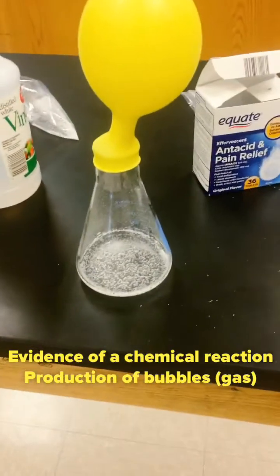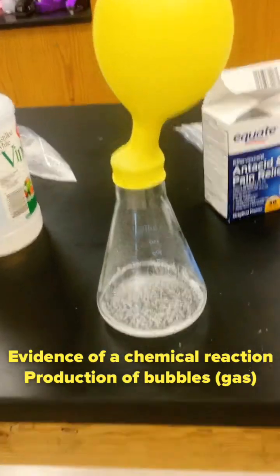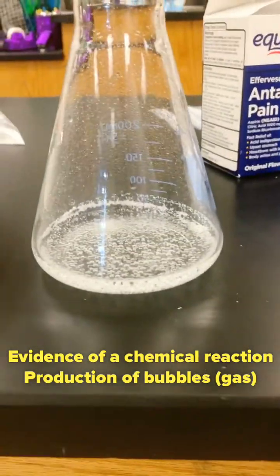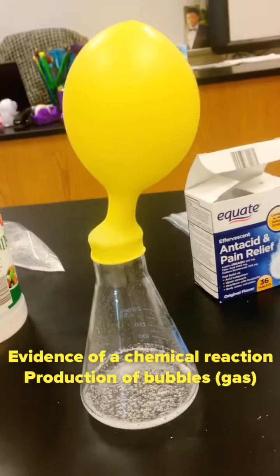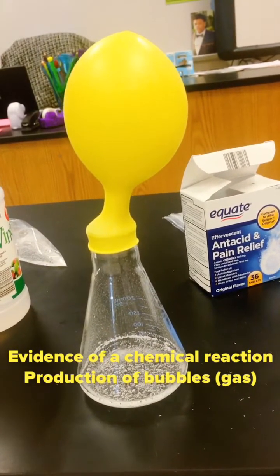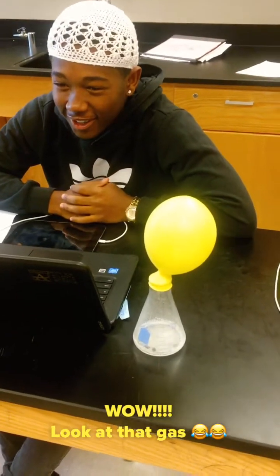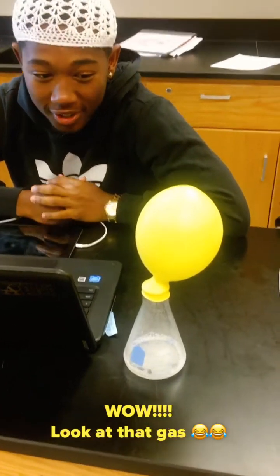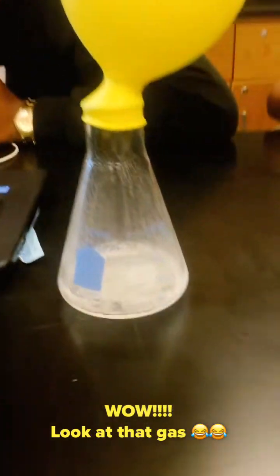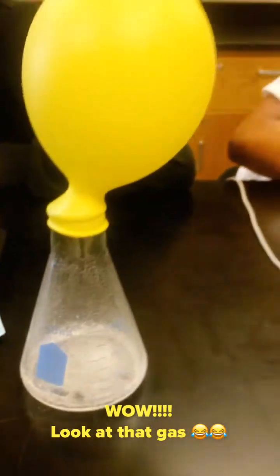As you can see, we still have a chemical reaction taking place. Yes, so our balloon will stay pumped up. Very, very nice. I think we have a lot of gas being produced here and still being produced. Maybe you put a very large tablet in there, you think? Probably.